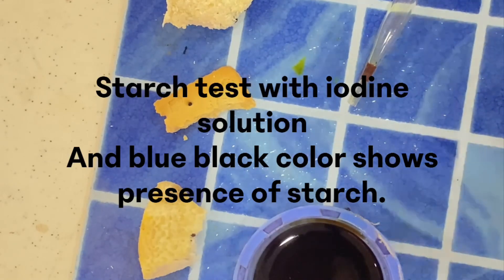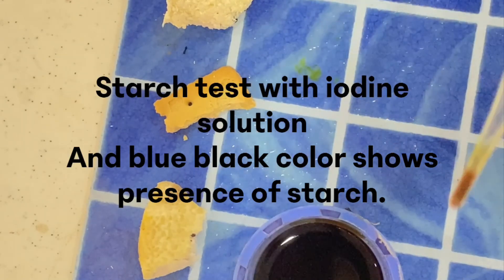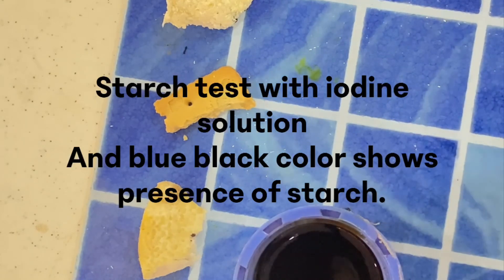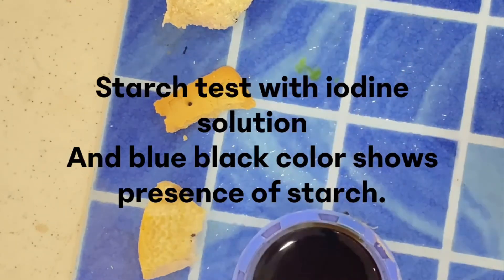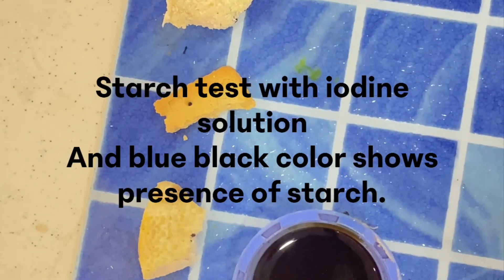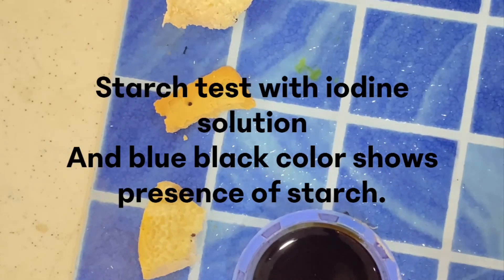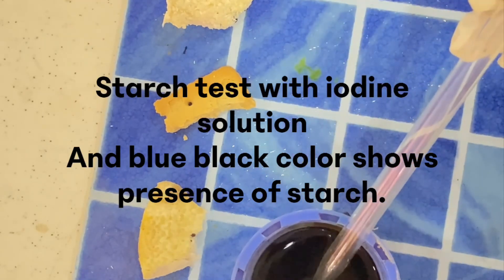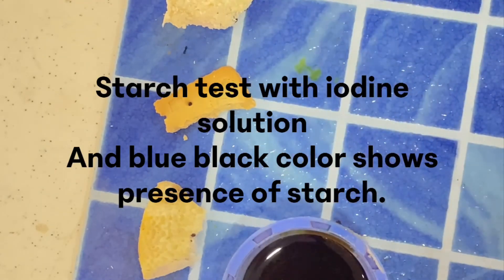If the color shows blue-black, it tells you that all the food showing blue-black has starch in it. Now let's see. I first drop it on the bread, and when the iodine came in contact with the bread, you saw blue-black.